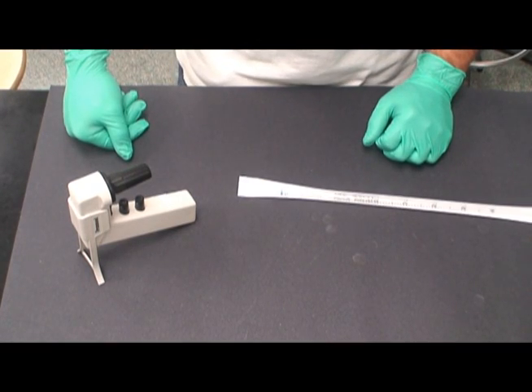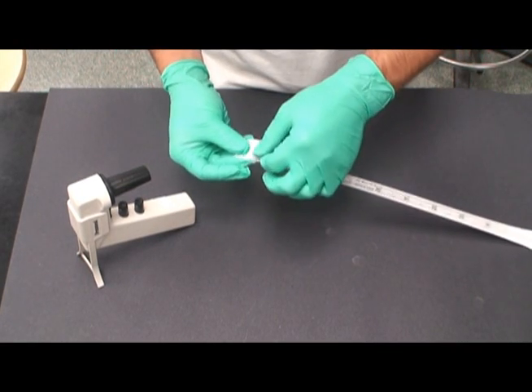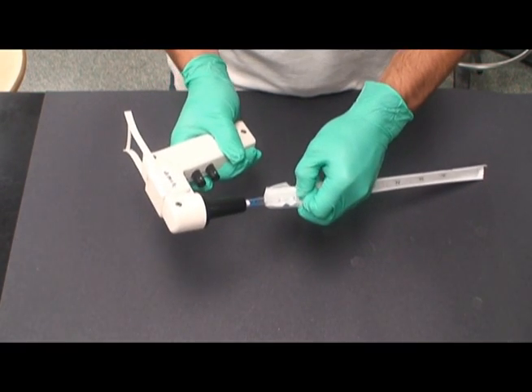Shown here is the proper way to open and attach the glass pipette to the device. The tip should remain in the wrapper until use to prevent contamination.